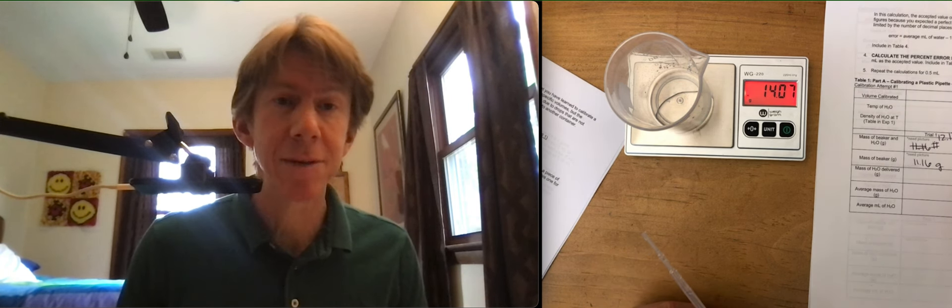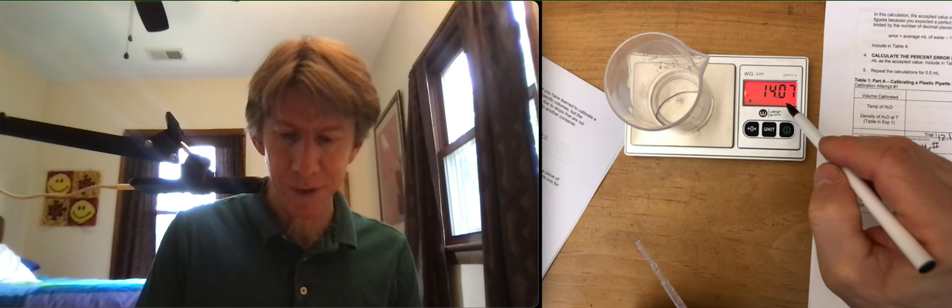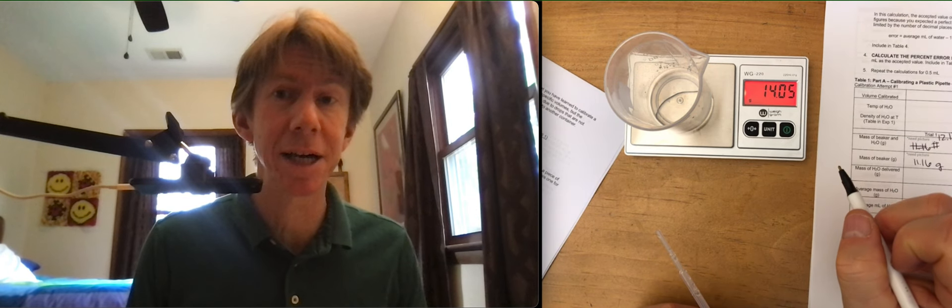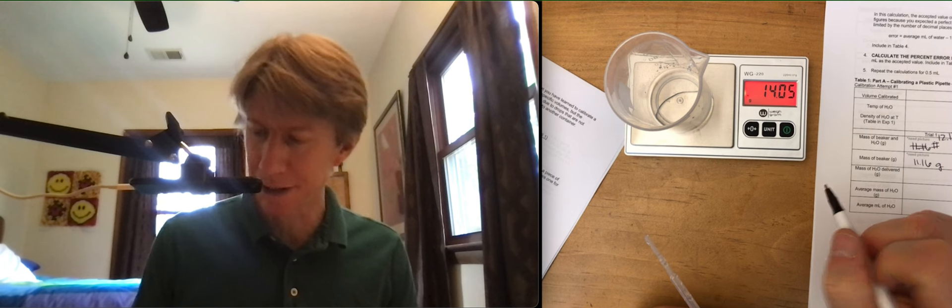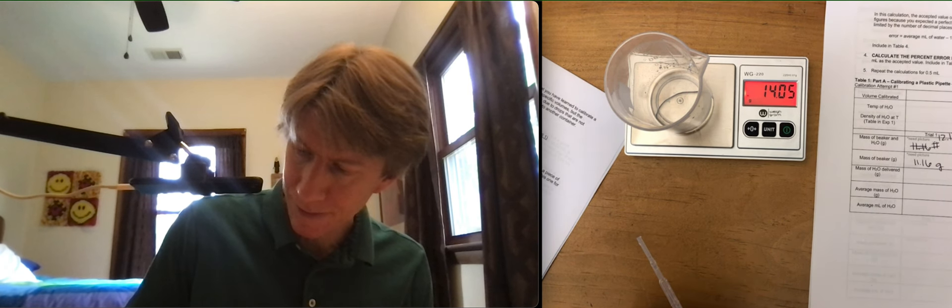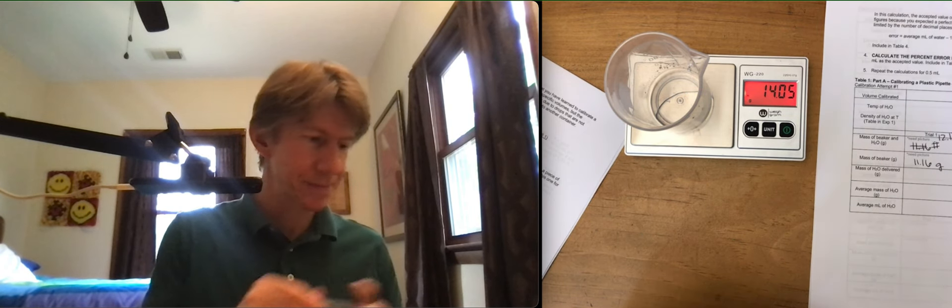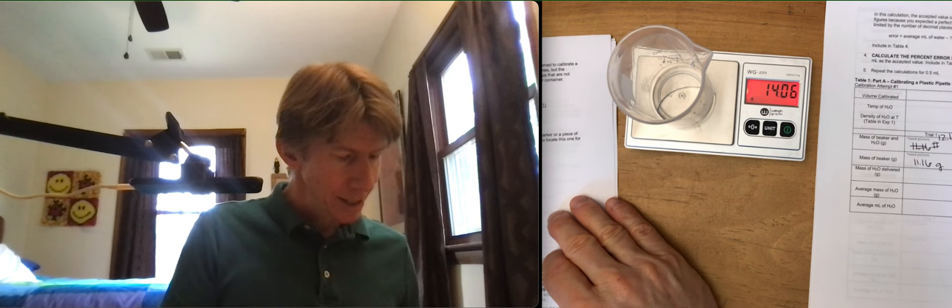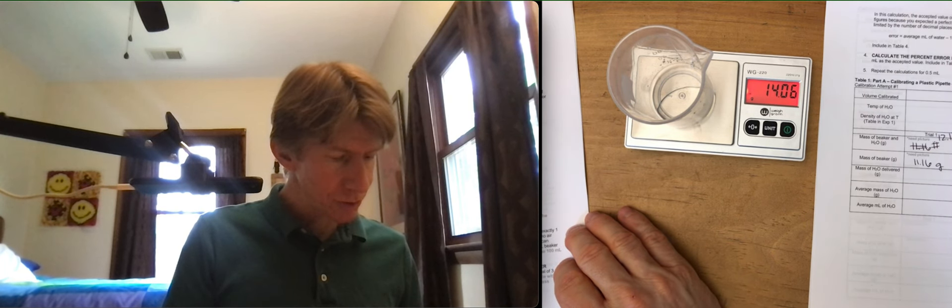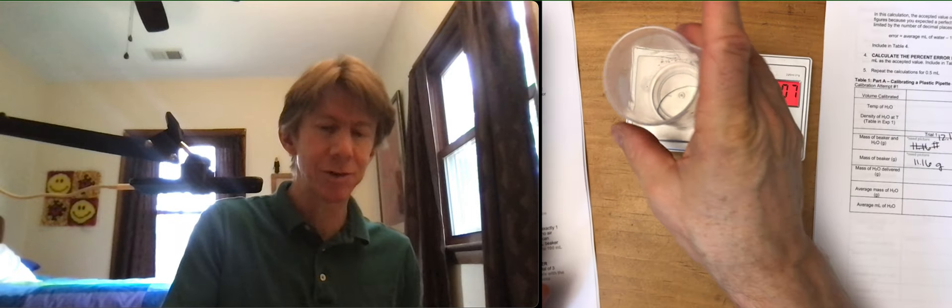I'm going to keep that at 14.05 grams. I'm going to set this aside. Take a picture each time, repeat it, take a picture each time. Empty the beaker. It is okay if it is not dry. I'm going to empty this into my waste beaker. Give it a couple shakes here.